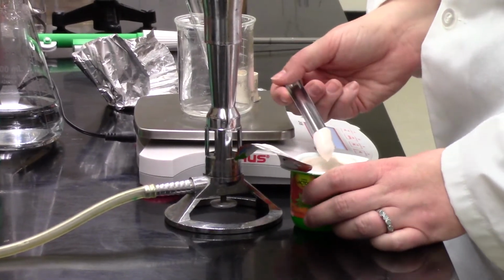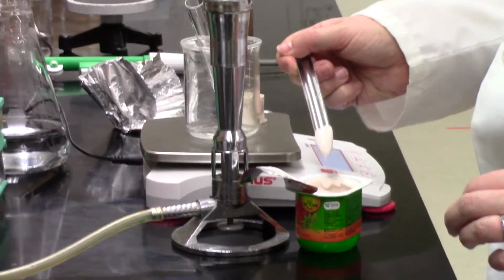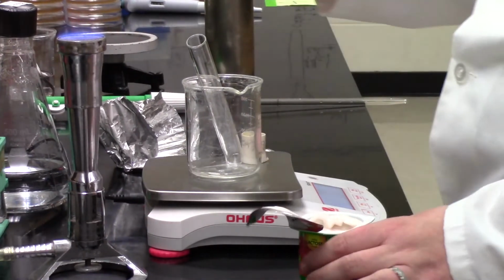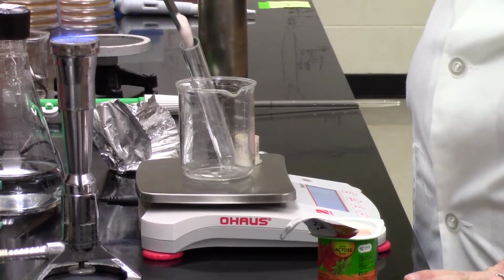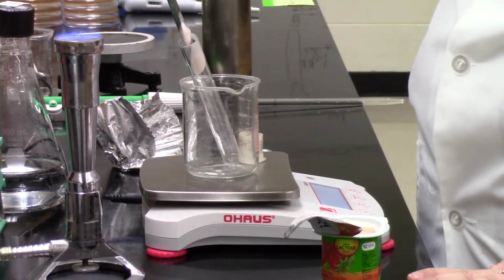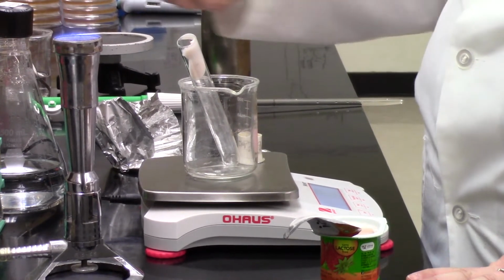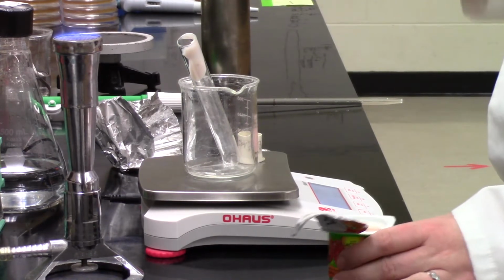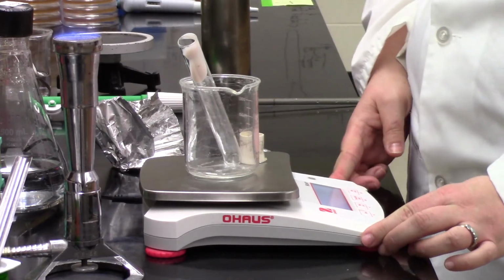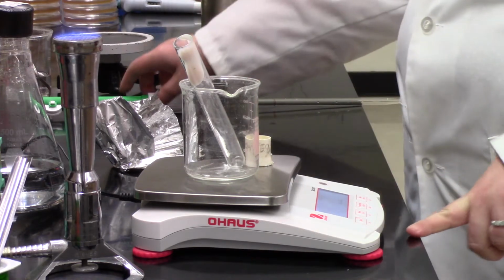And she's going to start scooping out. So she's got a sterile test tube again. It's a little hard to see there, but you can see it behind the Bunsen burner. Awesome, that works great. So she's going to start tapping in some yogurt, which is always a bit awkward to do, and she's already zeroed that. The test tube is sitting in a beaker on the scale. It's being zeroed so that we know exactly how much yogurt is going in. She's even got the cap of the tube there as well, because that was part of the weighing.